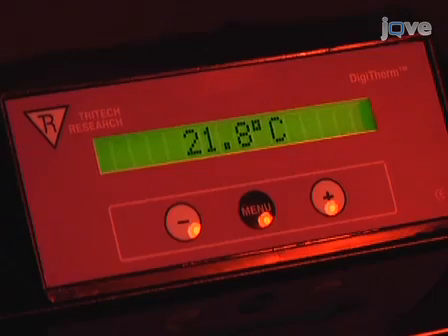Finally, mask possible light sources from LEDs of electronic devices or an improperly sealed incubator door with duct tape or black cloth to ensure free-running rhythms are measured in the absence of unwanted light.